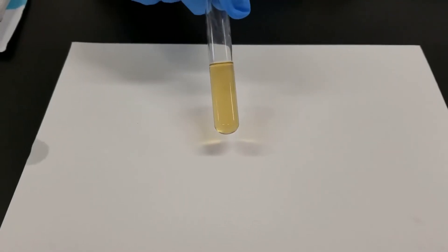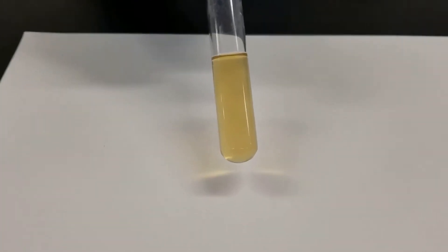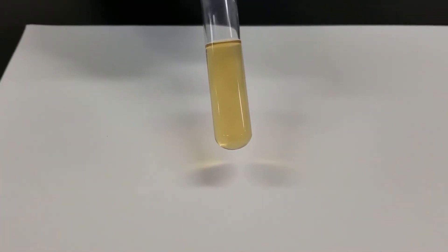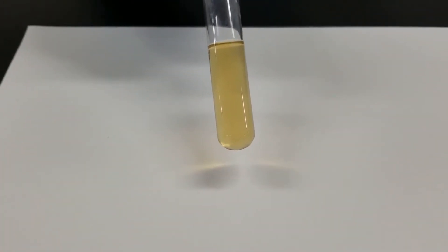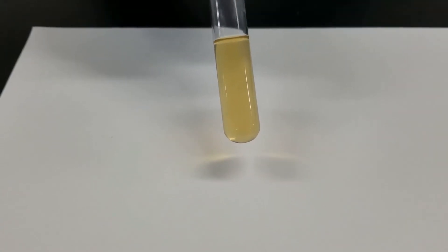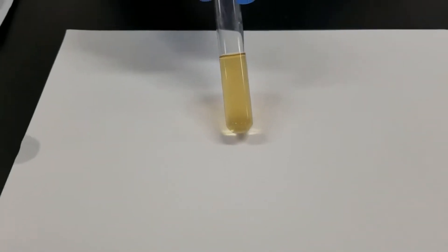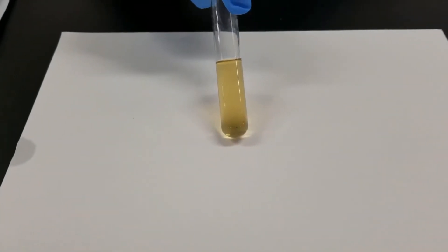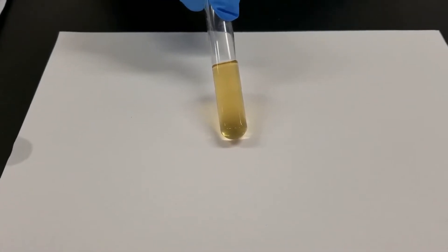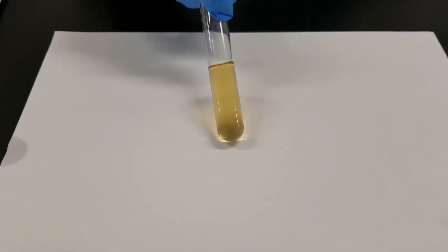This is a SIM tube — S-I-M — it stands for sulfide, indole, and motility. For this particular test, what we were looking for was more specifically the hydrogen sulfide production, as well as the motility.